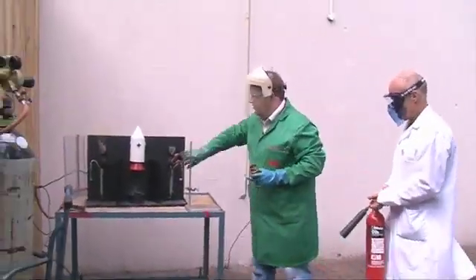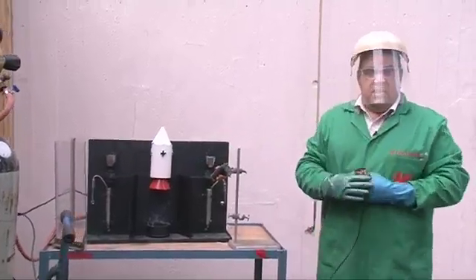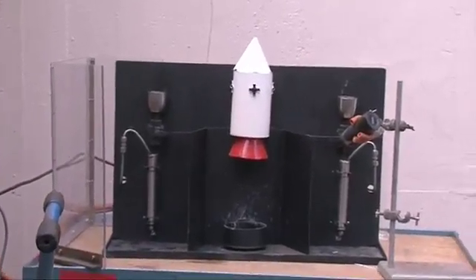So we prepare for firing by closing the second vessel, retreating to a safe distance, and opening the switch. Let's go.